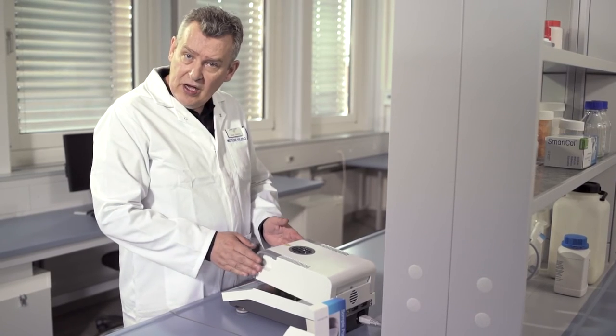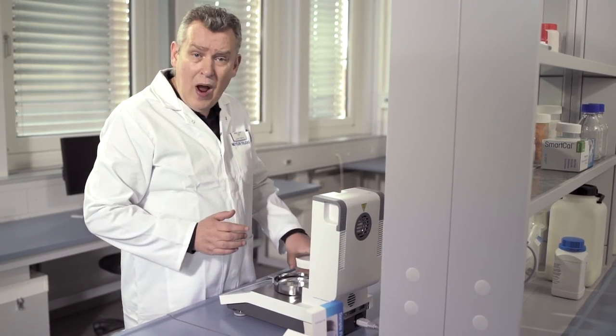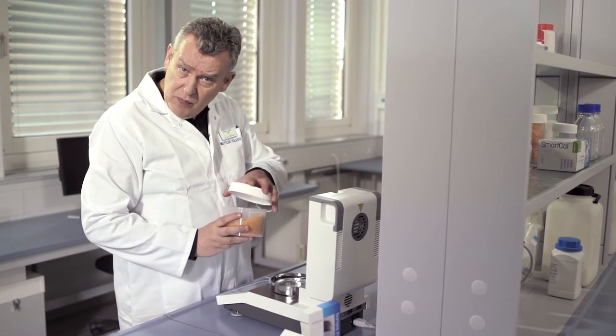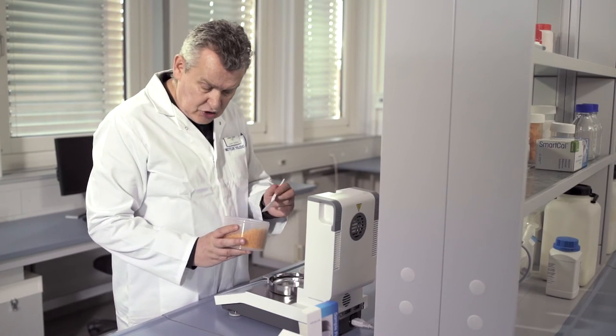Open the lid again, weigh in and distribute evenly the crushed potato chips.